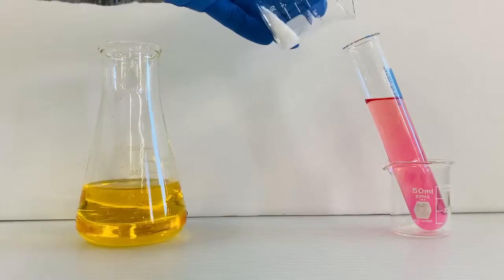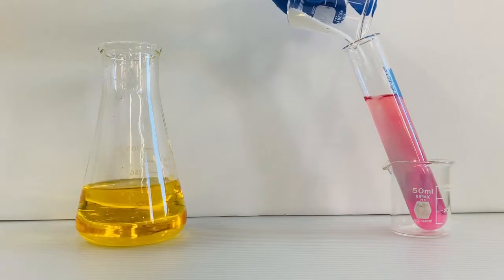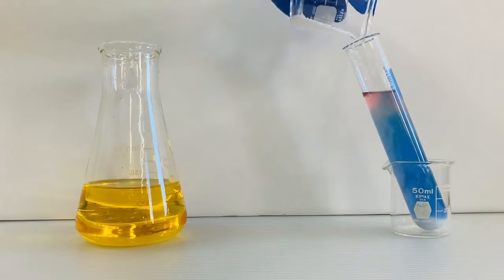Now watch what happens when we take this white solid and pour it into the red fluid. The color turns blue.